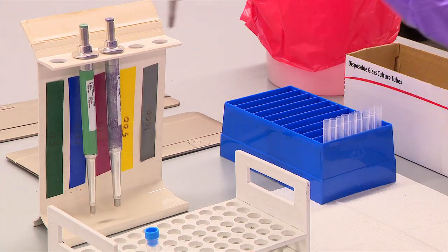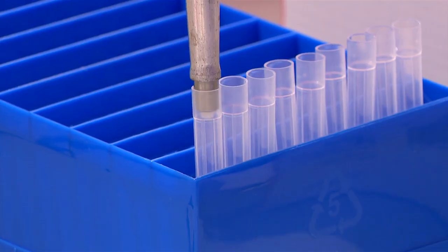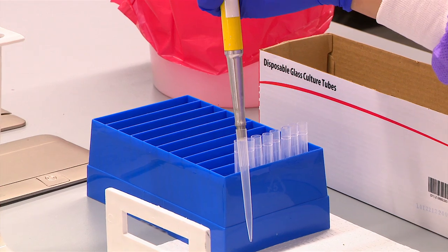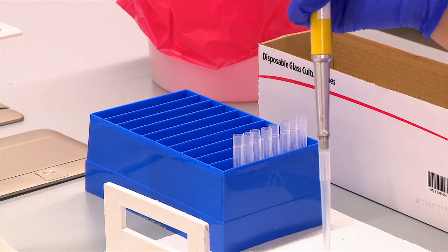We will begin by pressing the pipette nozzle firmly into an unused pipette tip. If the tip appears damaged or irregular, discard and replace the pipette tip.